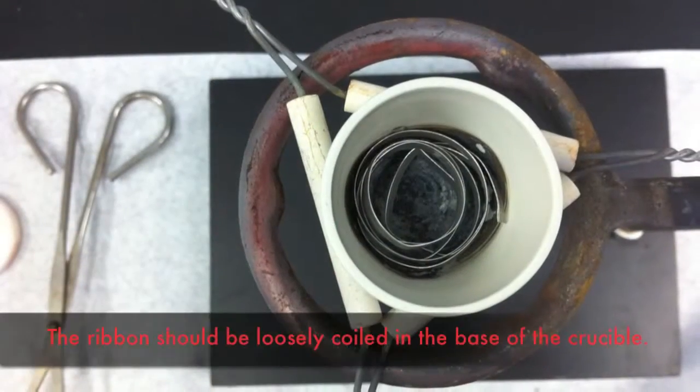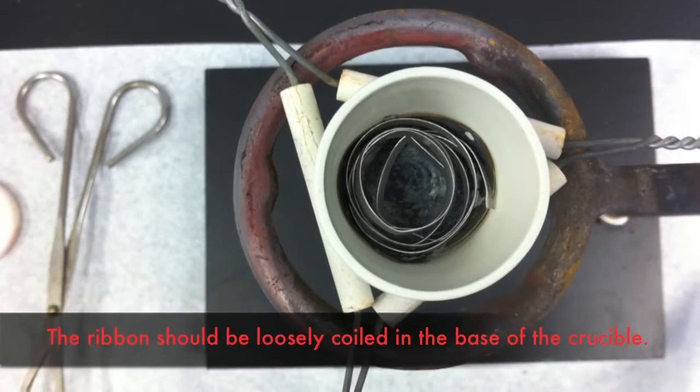Do not wrap the magnesium ribbon too tightly. Air needs to get in for the reaction to take place.